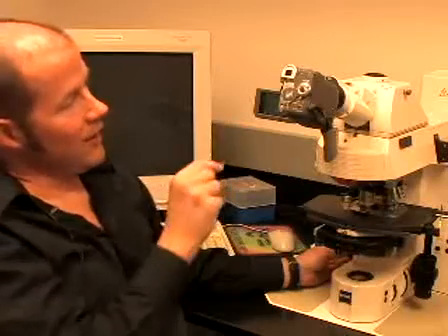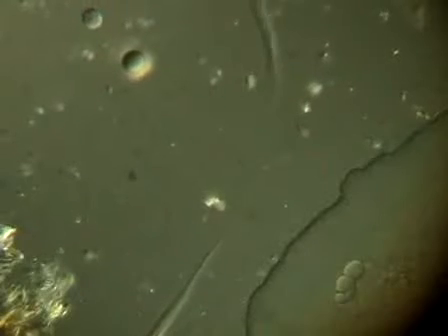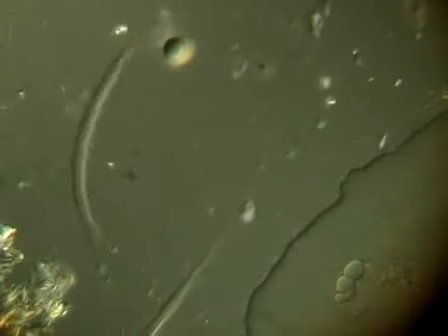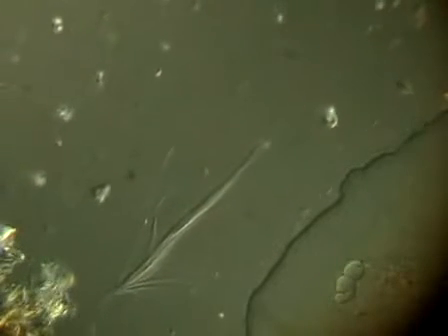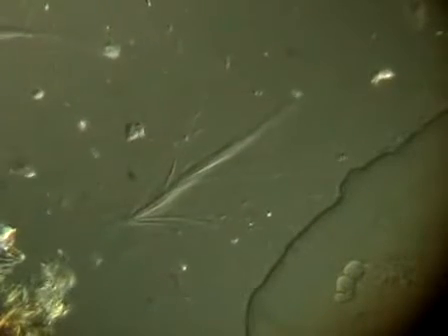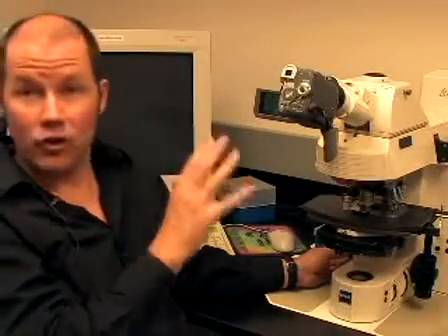And I call this the fascist protozoan because the protozoan itself is exceedingly thin, and from the very little that we know about it, studies have shown that it is covered with a coat of thin, long slender bacteria. So it's a long stick-like protozoan, a eukaryote, covered with a coat of long hair-like bacteria. Here you see some of these hairs starting to fray a little bit and come off, but you'll see a lot of these, and functionally we have no idea what they do.